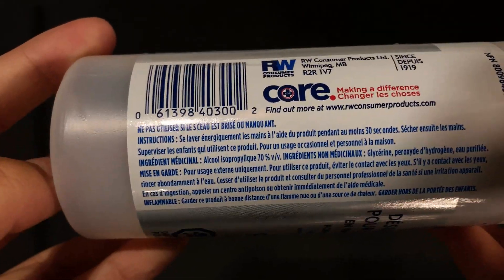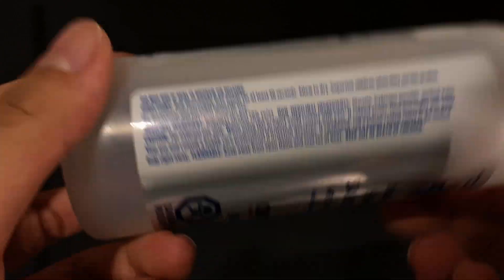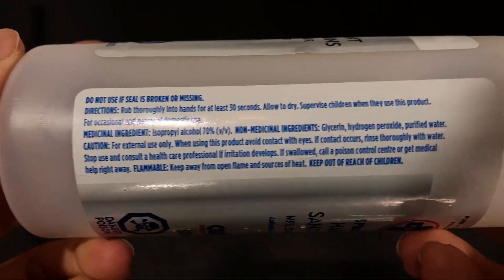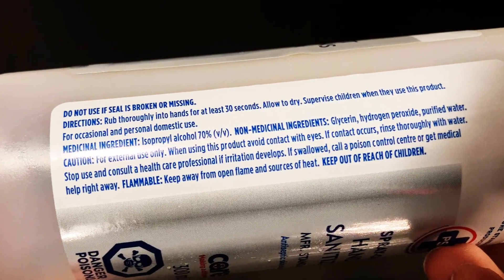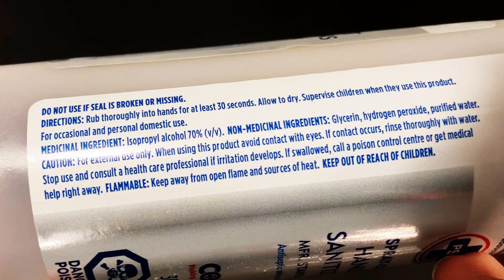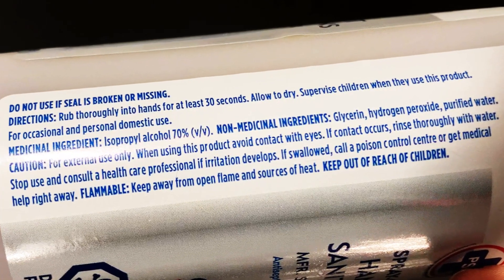First things first, I used this particular brand of liquid hand sanitizer. I'm not sure if it's possible to do this distillation with a gel one, but feel free to try. The one I used only has four ingredients: isopropanol, water, hydrogen peroxide, and some glycerin.